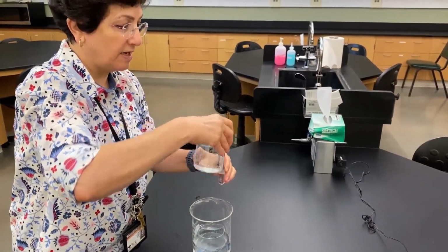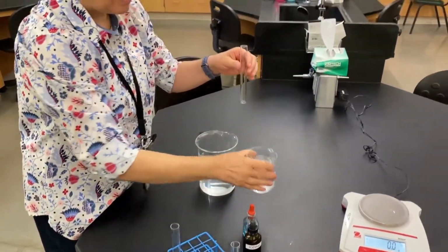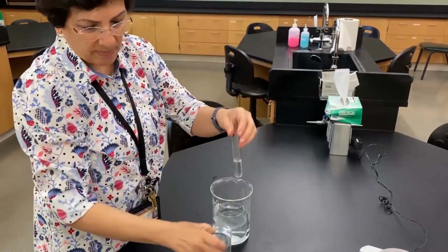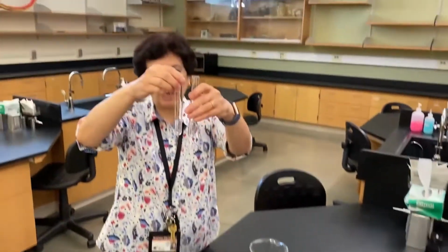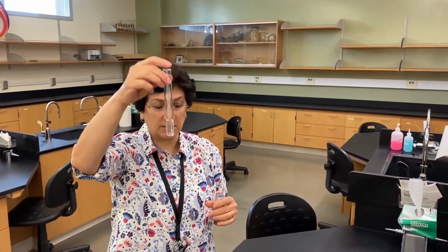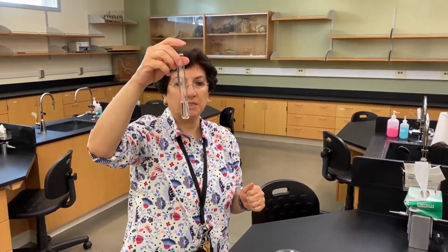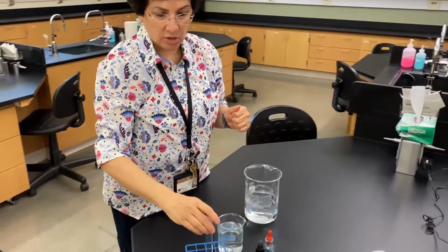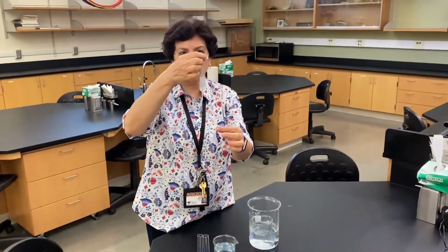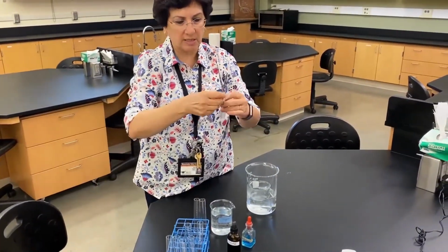We're going to see if any of the solutes left the dialysis bag and are now in this water in the beaker. So about the same amount, you don't have to be totally exact. So one of them, we're gonna test for glucose, the presence of glucose, and one, we're gonna test for the presence of starch. Then, we're gonna take the dialysis bag, we're gonna empty the content over 2 test tubes.